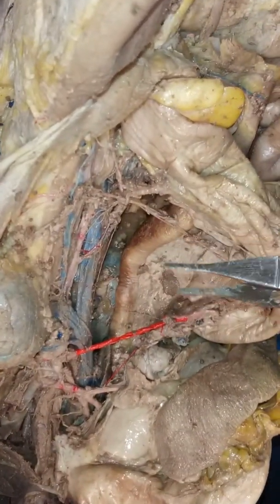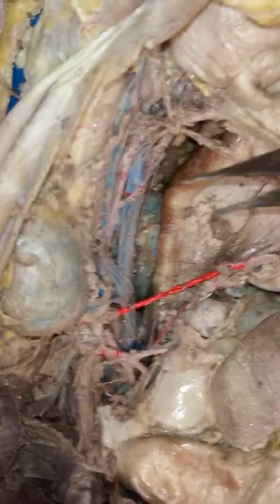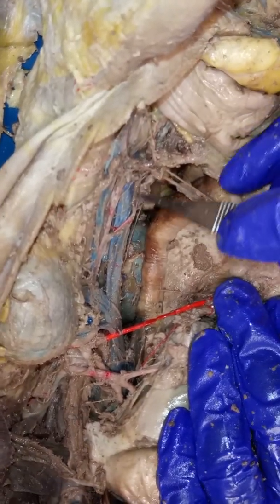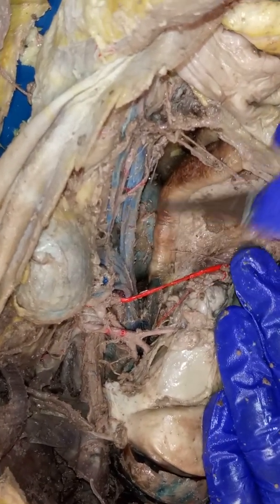Now, how about the blood that is coming back up? The blood that is going to be coming through the veins and what's going to lead to the inferior vena cava. So we're going to start with the inferior vena cava. And from the inferior vena cava, we're going to go up in this direction. Remember where it's going. Here's the inferior vena cava. What are some areas that we have to look at? Okay. The renal vein is going to be taking blood from the kidneys.